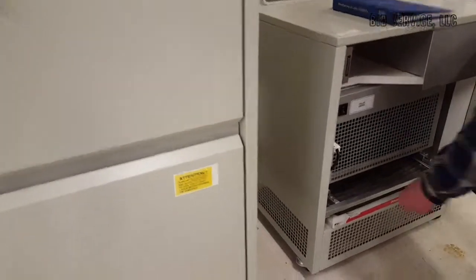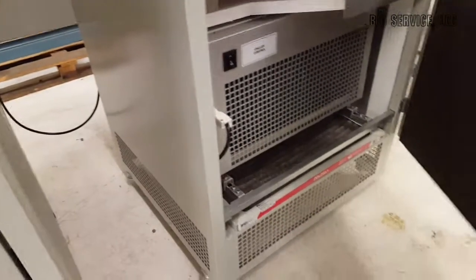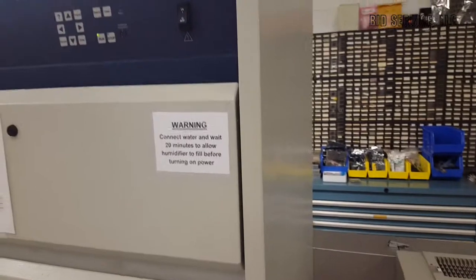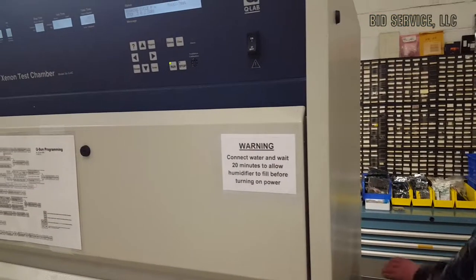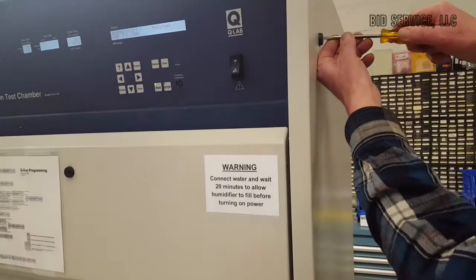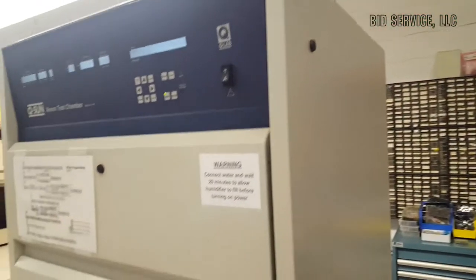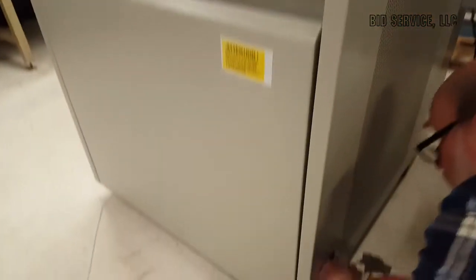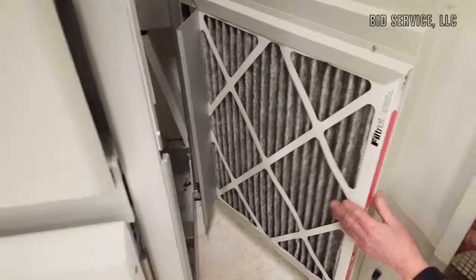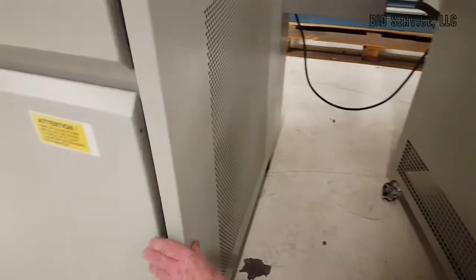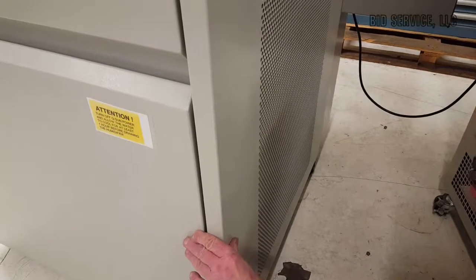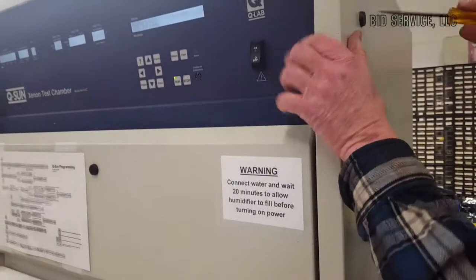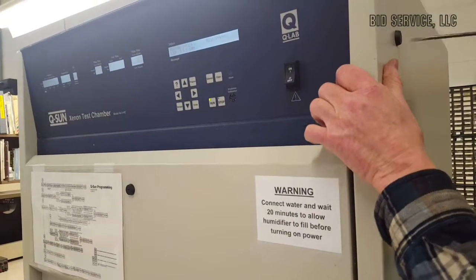There is both a filter in here. And then all you need to do is take the screwdriver, for example. This comes off real easy. Turn that. And turn that. And as you can see, we have another filter inside here too. These are common filters of a common size that you can just about get anywhere, Home Depot or any place that would have heating and cooling type of filters.